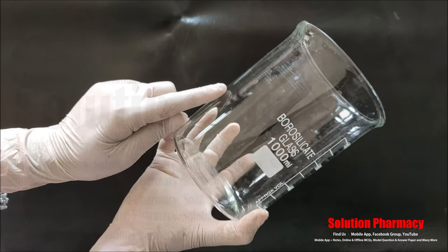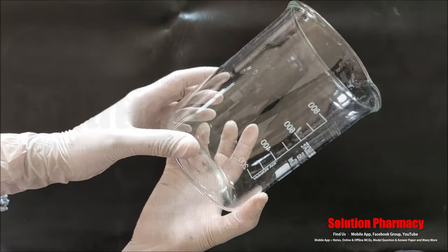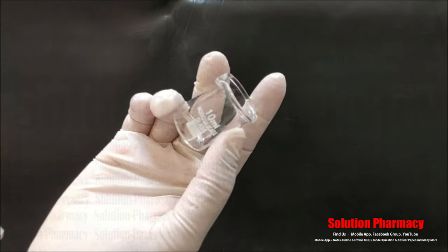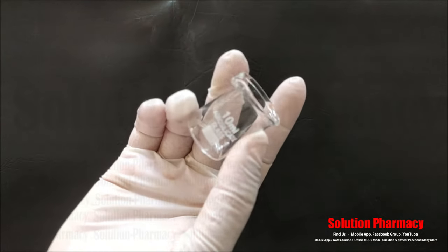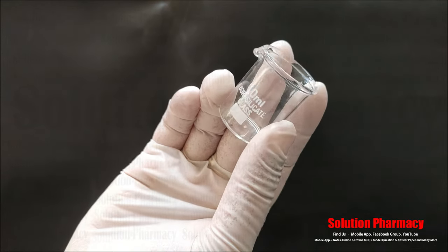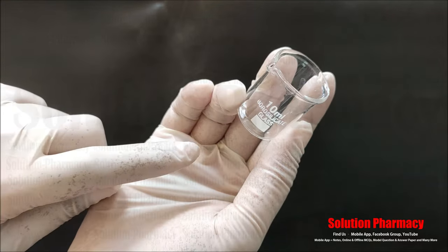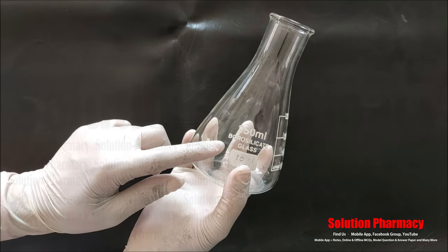You can see this beaker is cylindrical and has a spout for pouring liquid. Next, you can see this is a very small 10 ml beaker, also made of borosilicate glass. If we have a very small volume or a very small amount of solution, we can use this 10 ml beaker.